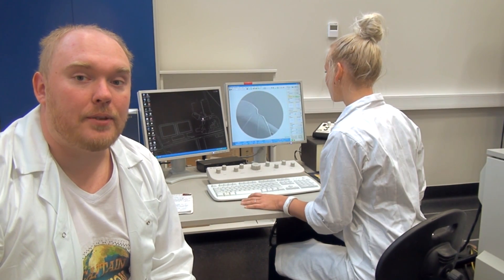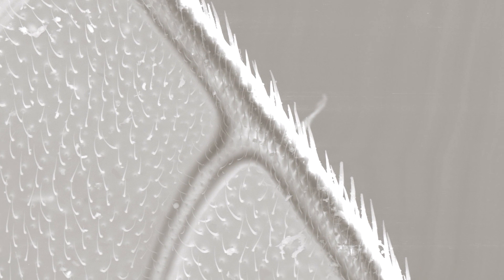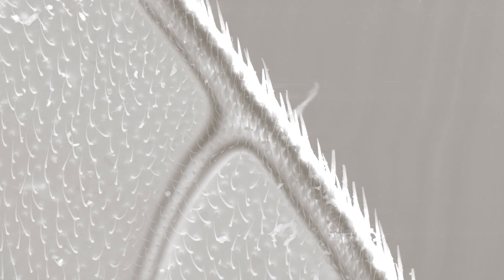Let's take a look at the wings as well. The wings are generally transparent. They are attached to two kinds of muscles: those used to power the flying and another set used for fine control of the wings.